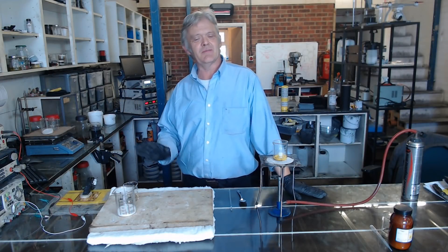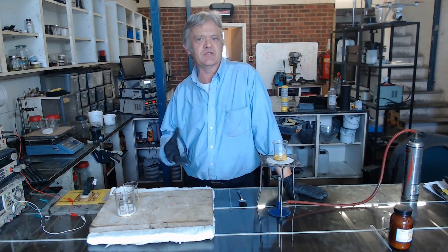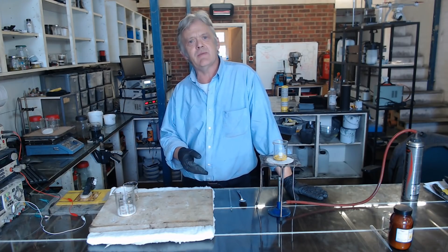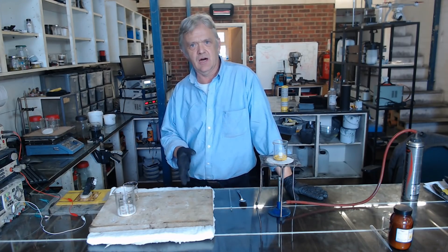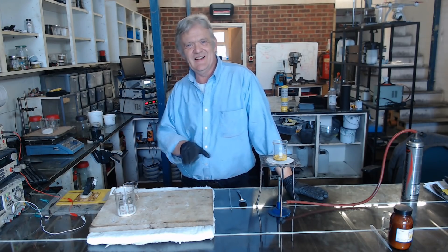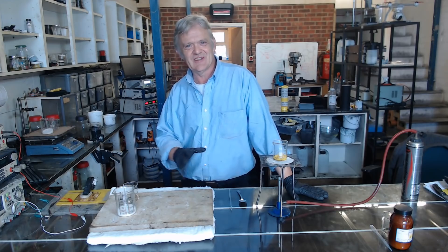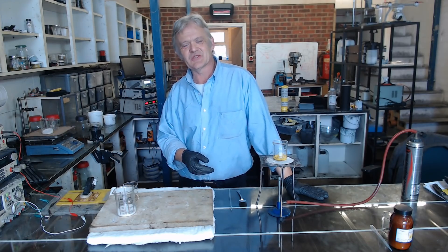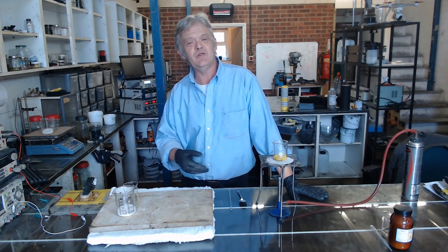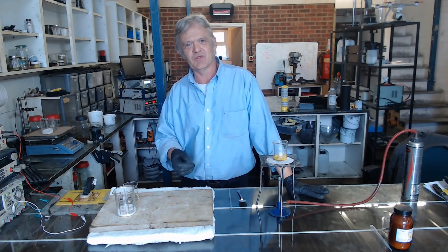I've been asked quite a lot of times to look at the production of carbon snakes. People want a relatively easy method to make a high surface area carbon. I've looked at three methods and to be honest they're just fun to do, so I thought I'd give it a go and show those three methods. You could use the carbons produced in batteries or something like that.